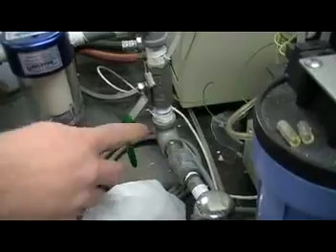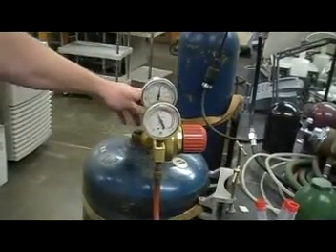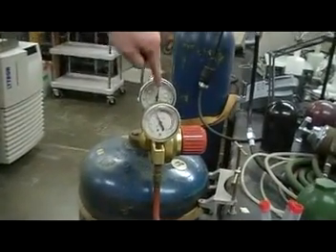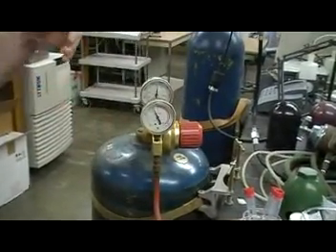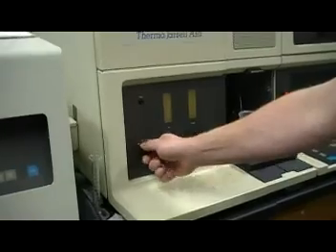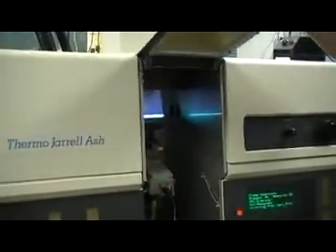degrees to the pipe. And then here we have our acetylene tank, and I've turned the knob on to turn the acetylene so the acetylene can go into the instrument. Basically, one thing you need to be aware of is if this arrow goes below the red 150, we probably need to change the tank, because then we're getting too much acetone in the flame, and that's going to adjust the flame condition. Off, we turn it from off to air fuel, and then to start the flame, if you see here, you hit the pilot button, there'll be a pilot light that lights the flame.